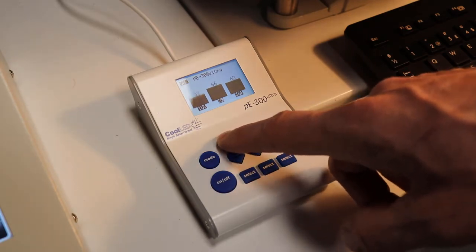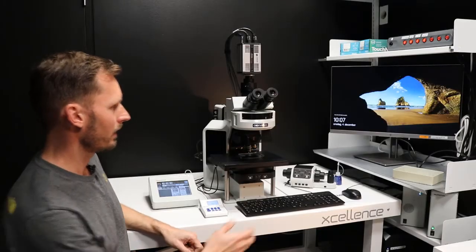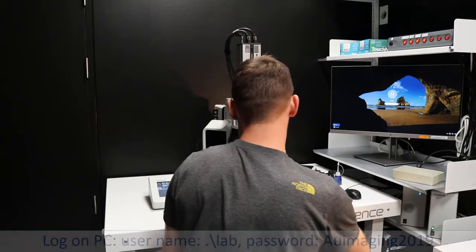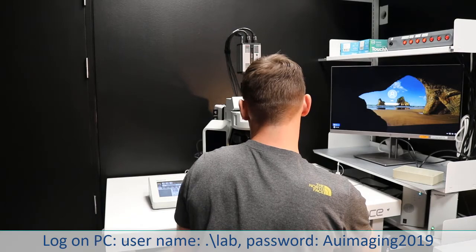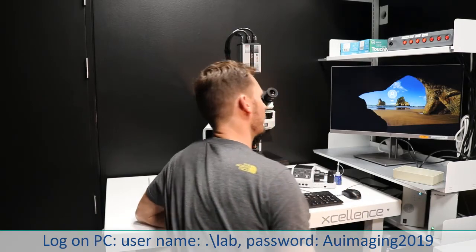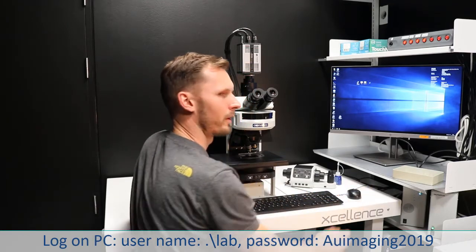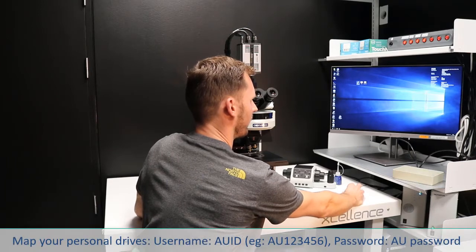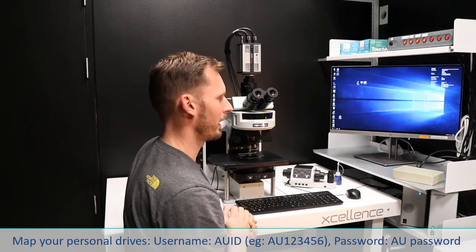If you use the software, then everything is controlled here in the software. And now I will turn on the computer to be able to control everything from the software. So the only thing you need is these three icons. CellSens Dimension is the software we use to control the microscope, and the other ones are just for mapping our drives.